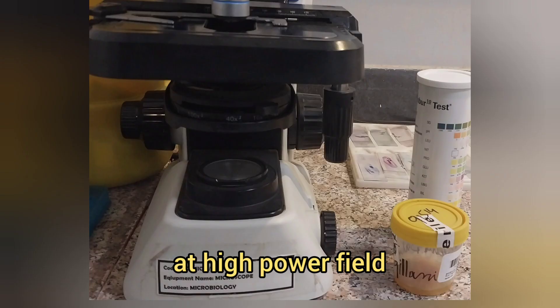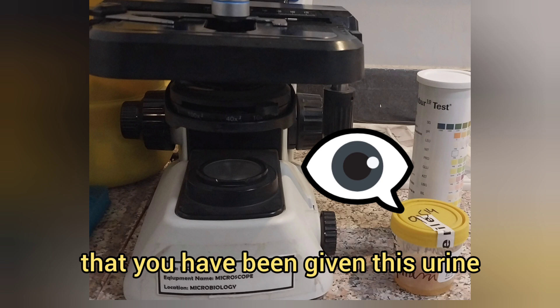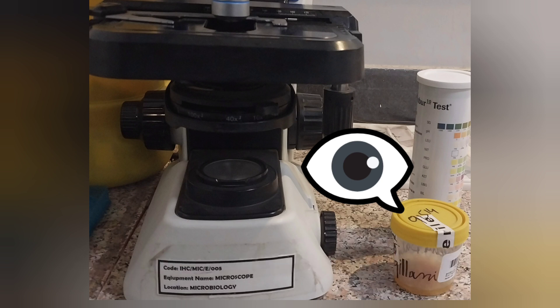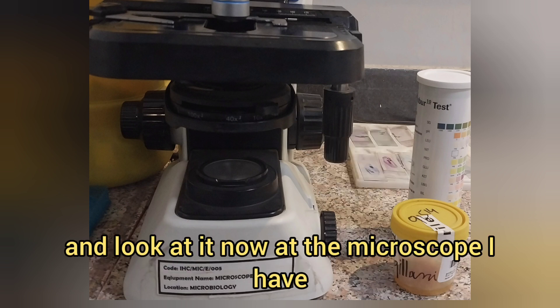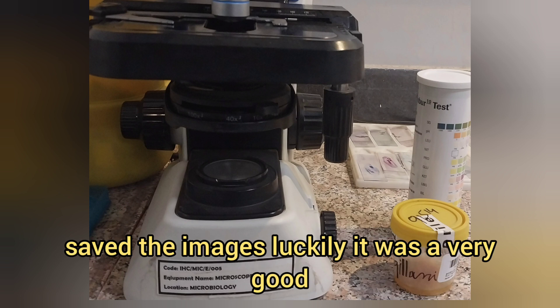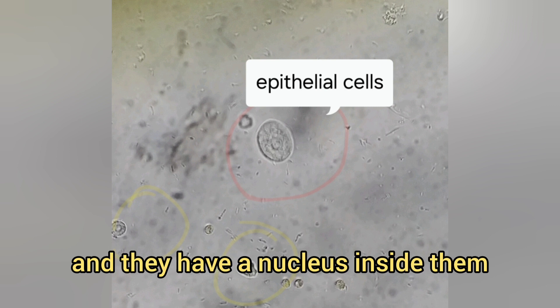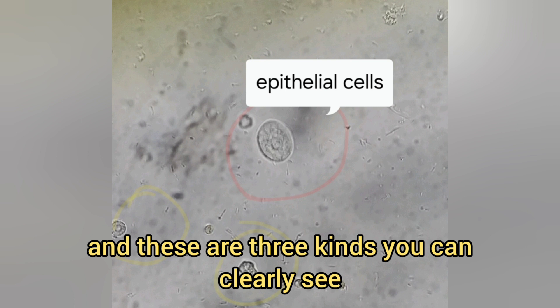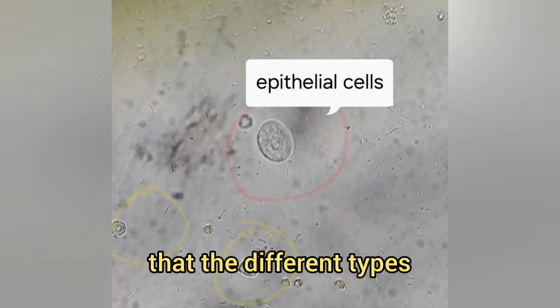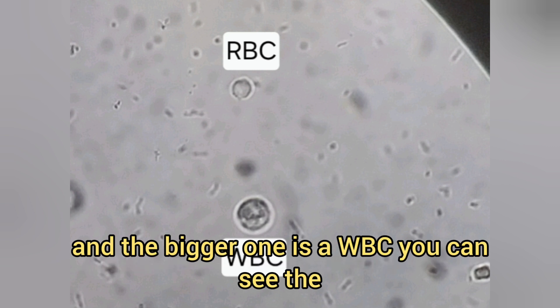Let's take this case scenario: you have been given this urine, you've done the dipstick, and now look at it under the microscope. Epithelial cells are large with a nucleus inside — there are three kinds you can clearly see. This is an RBC — the smaller one — and the bigger one is a WBC, with the nucleus image visible inside as well.